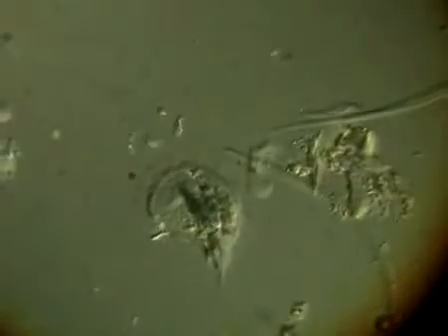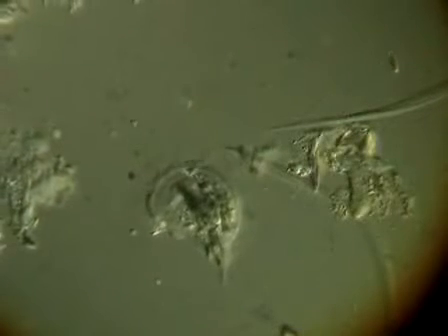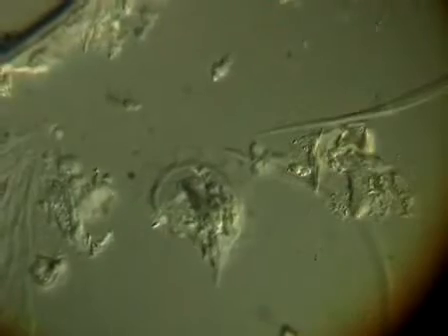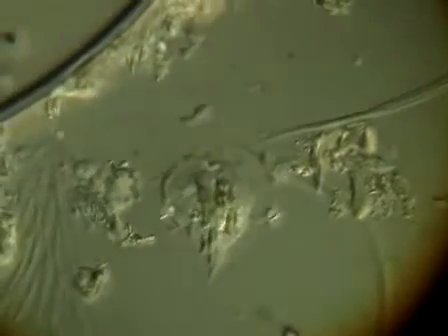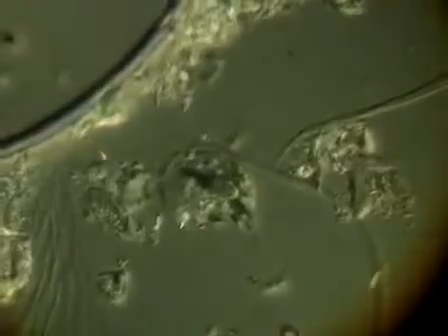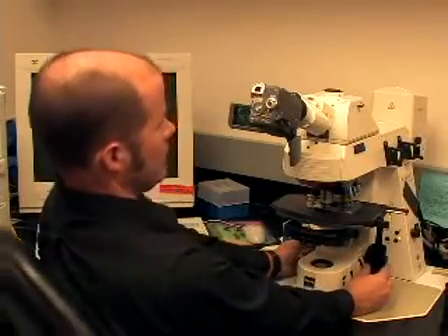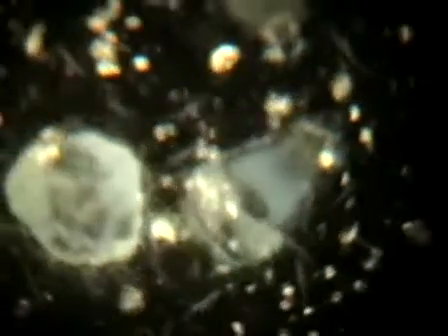And there are some adjustments you can make. It's a little bit like cooking. You can do it to taste, which is you look at your sample and you just make the adjustments to bring out in that particular sample some of the textures of the cells. It's almost empirically determined. So now I'm just going to try and find a few other objects worth looking at. This is looking on dark field now, where the biological material appears bright white on a black background.